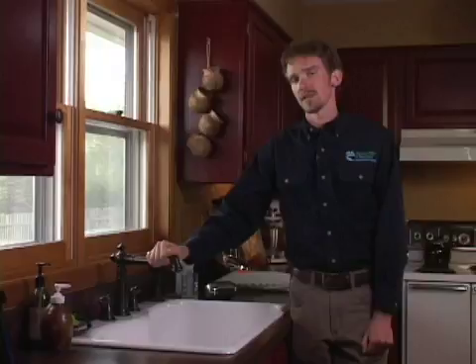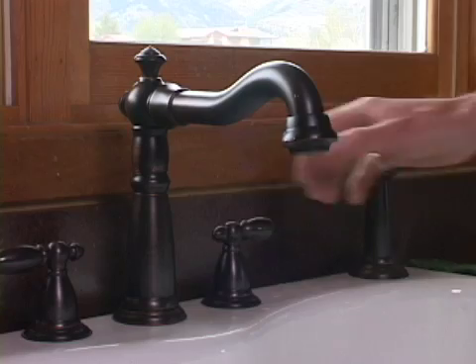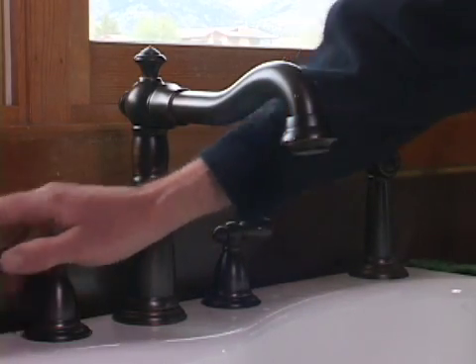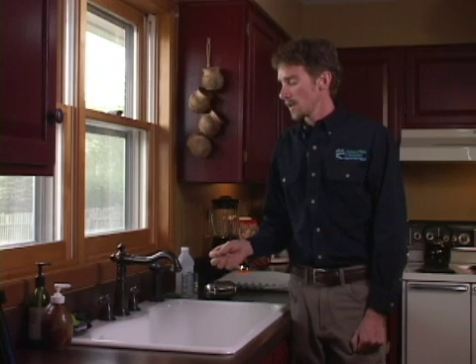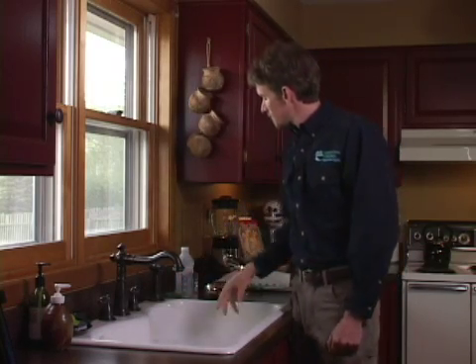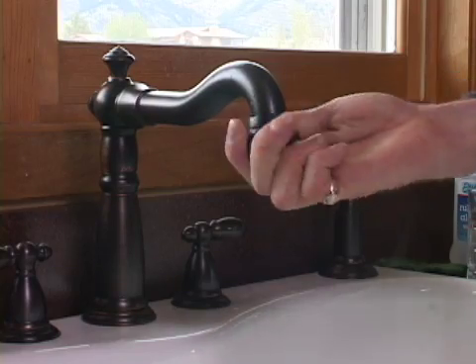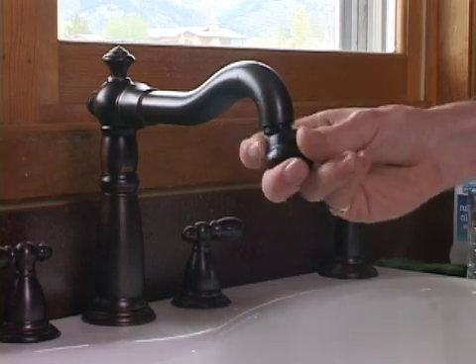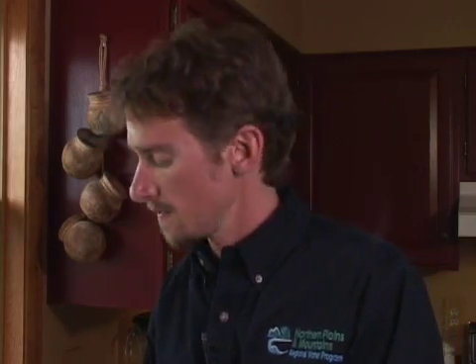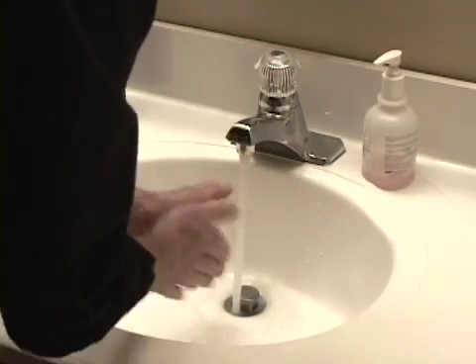I've selected the kitchen faucet to sample. Ideally, you want a faucet with separate controls for hot and cold water that doesn't swivel, because bacteria can reside in the cracks of those controls and give a false positive on your bacteria test. I'm going to remove any treatment device installed at the tap, such as a carbon filter, and also the aerator screen — these devices can harbor bacteria and cause a false positive. It's also important to wash your hands to avoid contaminating the sample.